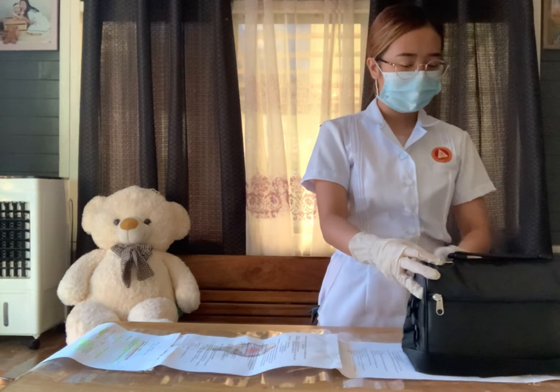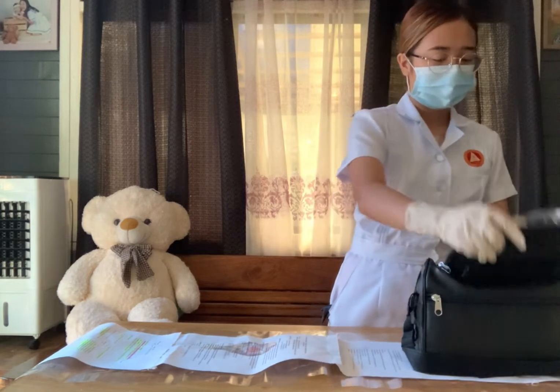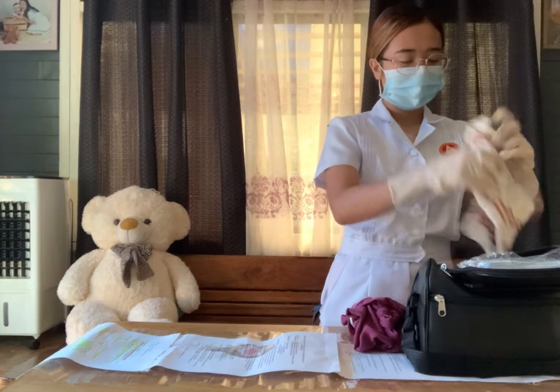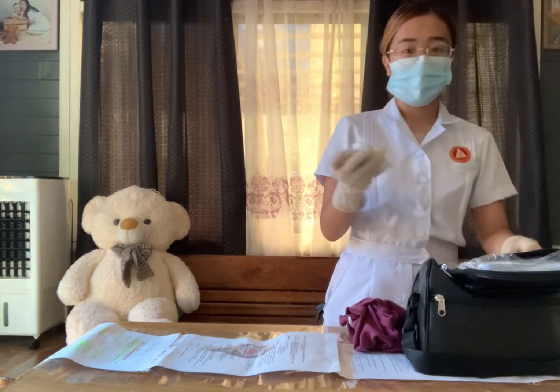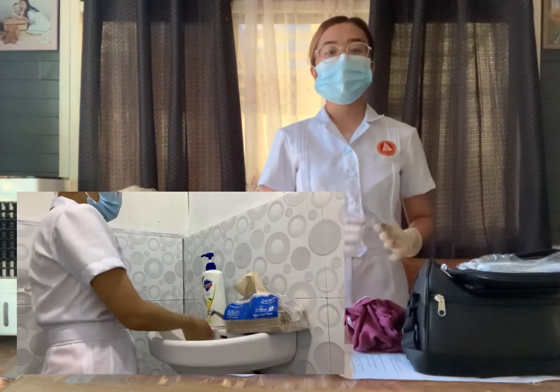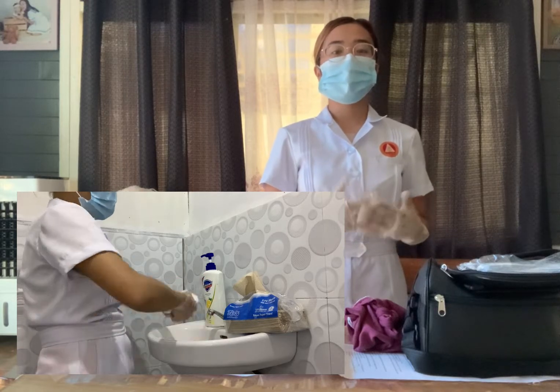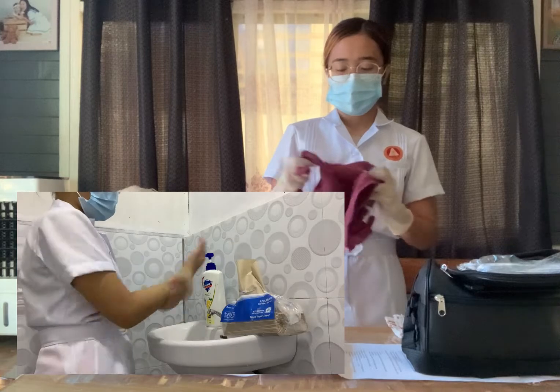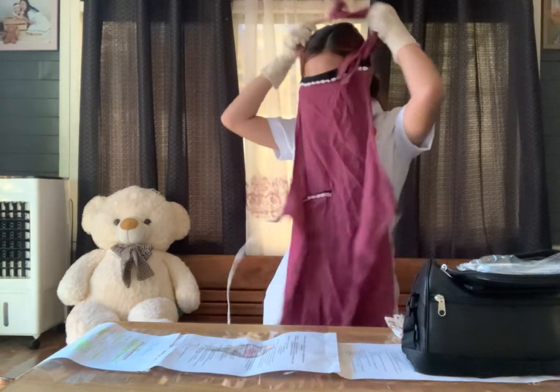Take the apron, towel, and soap out of the bag. After that, we need to perform a thorough hand washing and dry our hands, then put on our apron. When putting on the apron, make sure to put it right side out.